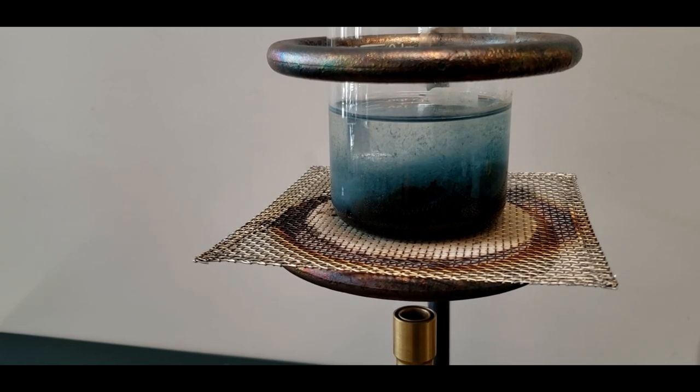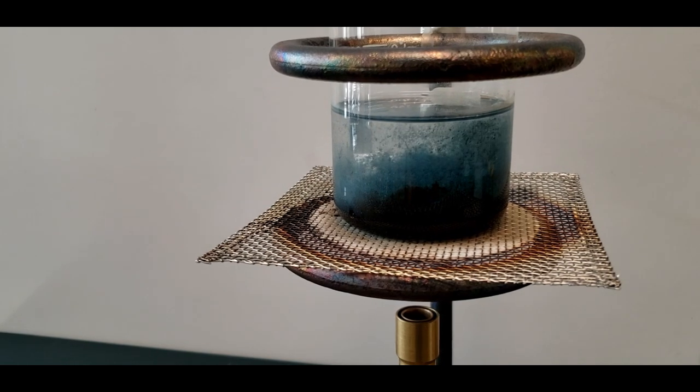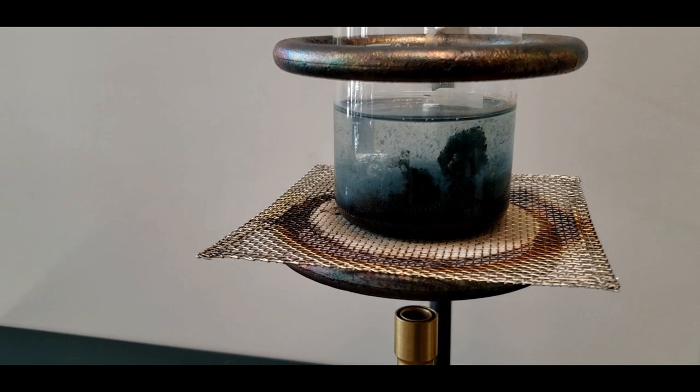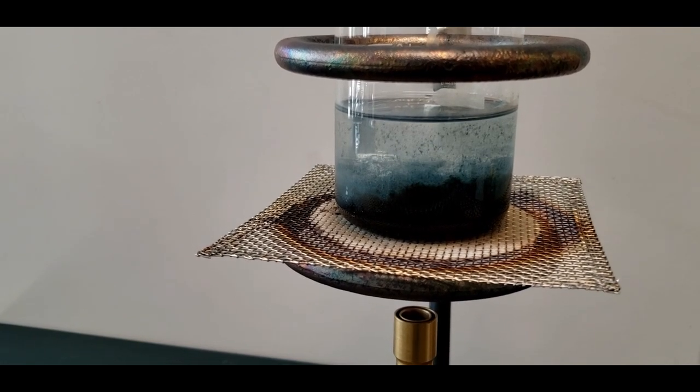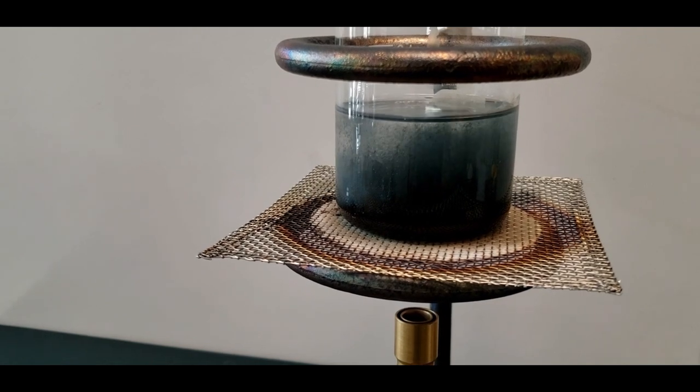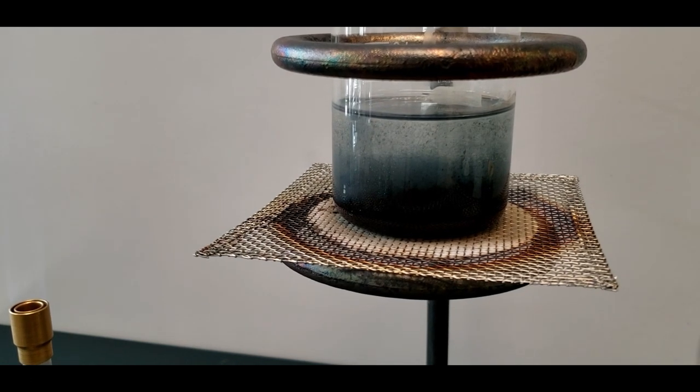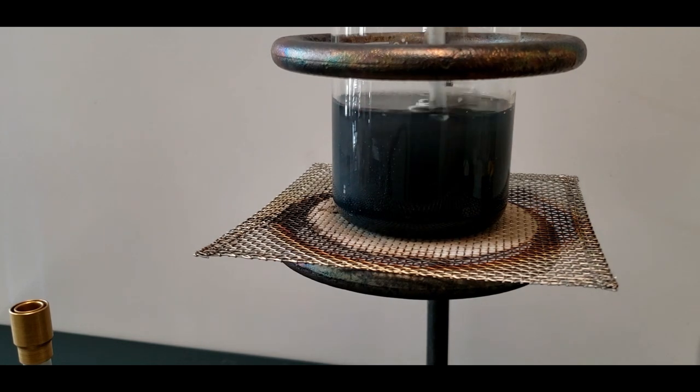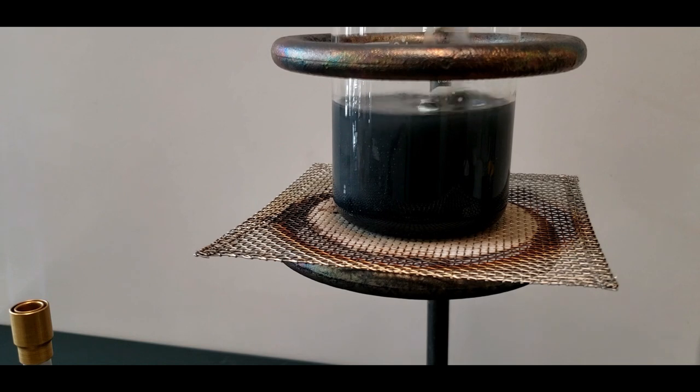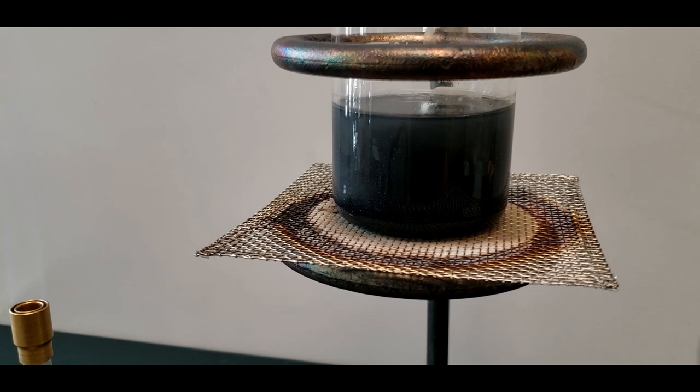Now this has to be a basic solution. So I added in a little bit more of the sodium hydroxide solution just to make sure it was plenty basic. And I can see it slowly reacting. The puffing is just the bubbling or boiling of the water. So I got to probably pull this away. We don't need it blasting all over the place. So to me looking at it, I can see a slight blueness to it. We want to make sure that we go until everything's reacted. Then it gets really tough to tell when it gets very dark, very dark brown. You can't really see the blue anymore.